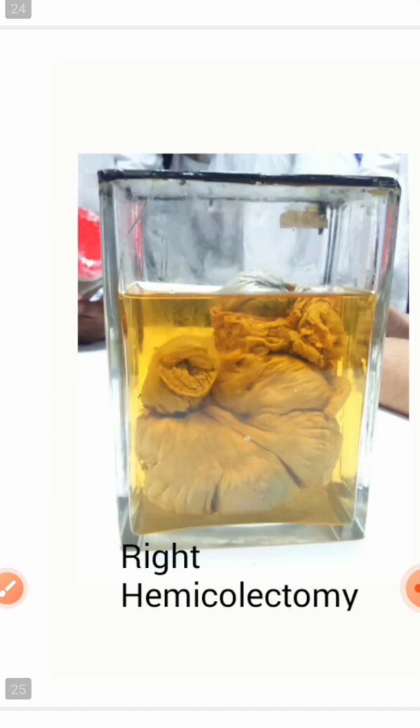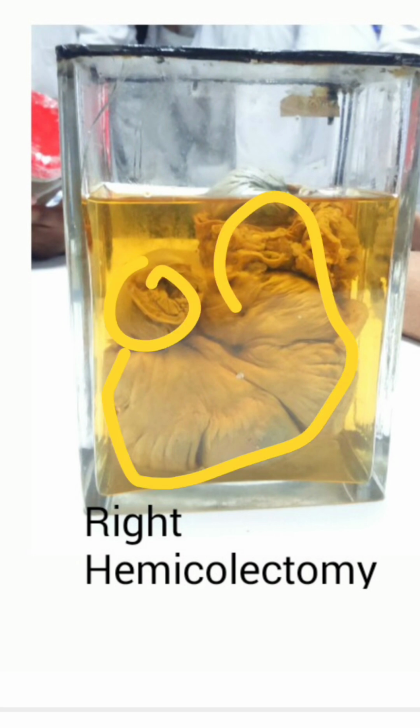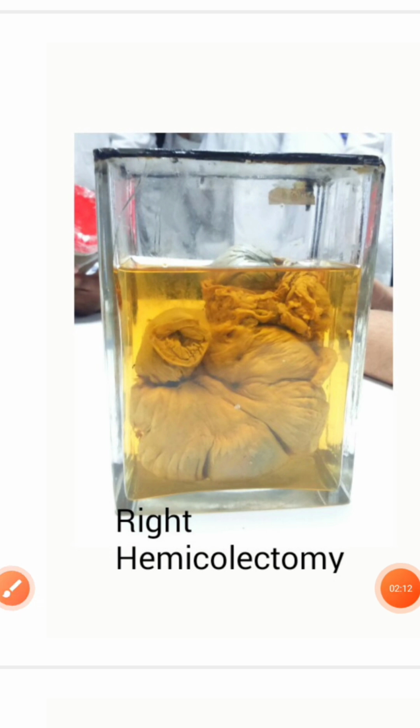Okay, this one is a right hemicolectomy. You can see the ileum here, and here is the cecum and the large intestine. Most commonly right hemicolectomy is done for colon cancer. So you can tell this one is a specimen. First identify the anatomy, then the pathology.